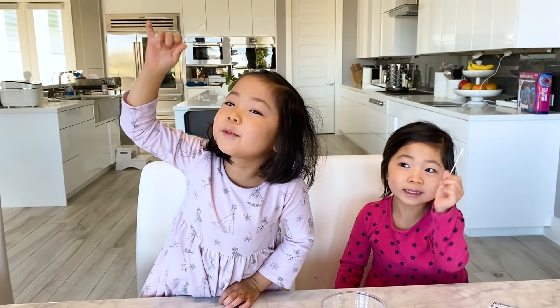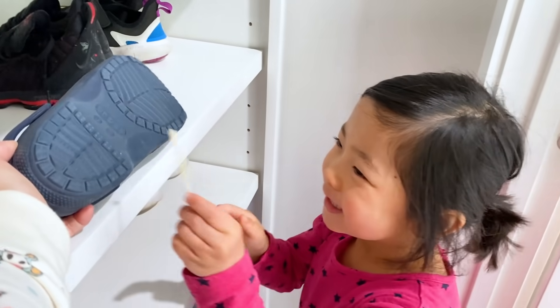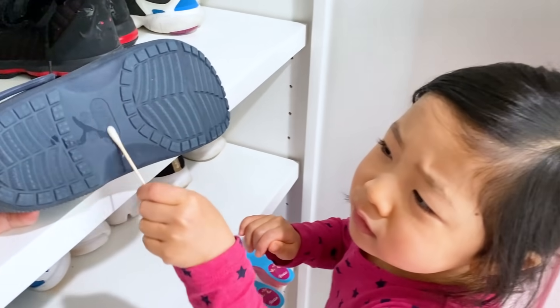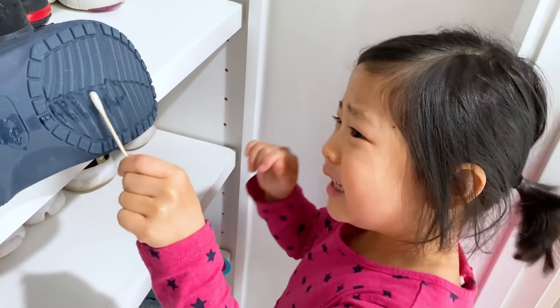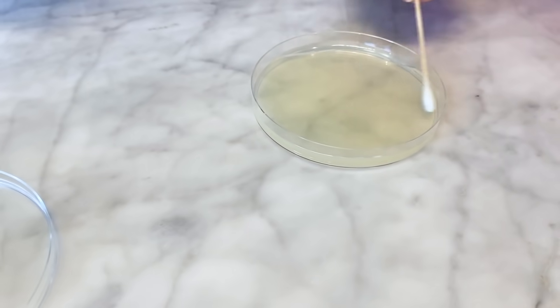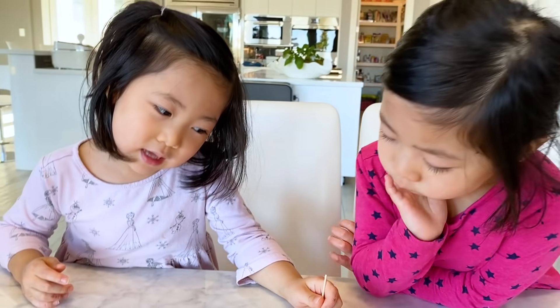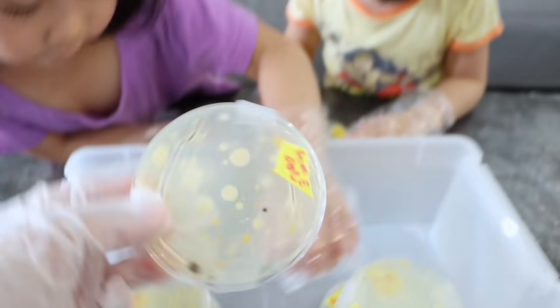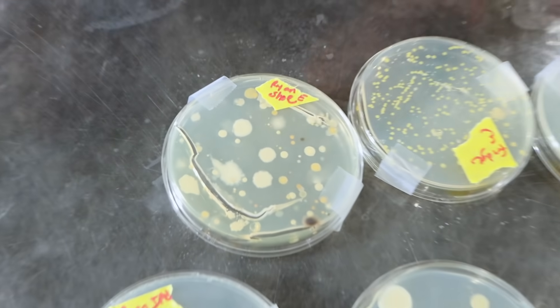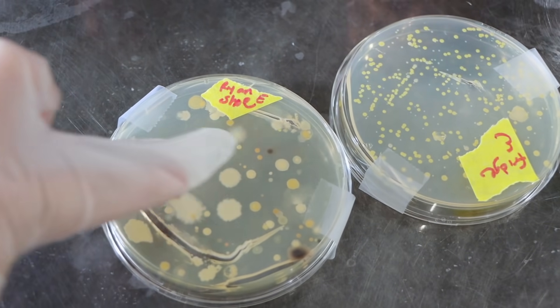All right, girls, what are we going to swab next? My shoe? Yeah. So Emma picked the sandals. Turn it around. Oh, it does look pretty dirty, huh? Yeah. You think there's bacteria on there, Emma? Yeah. Just lightly swab, just like that. Do you think there's lots of bacteria on there? Yeah. Here is our bacteria — this one is actually Ryan's shoe. Look how many bacterias are on Ryan's shoe.